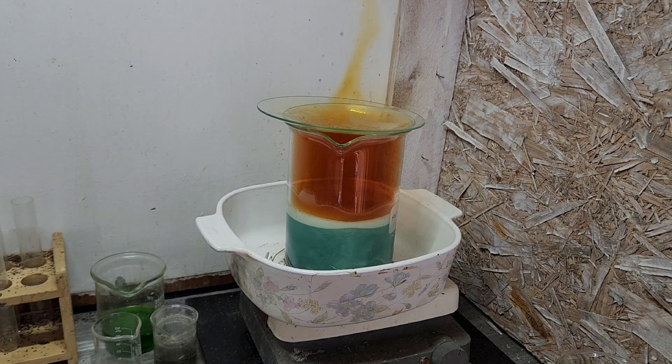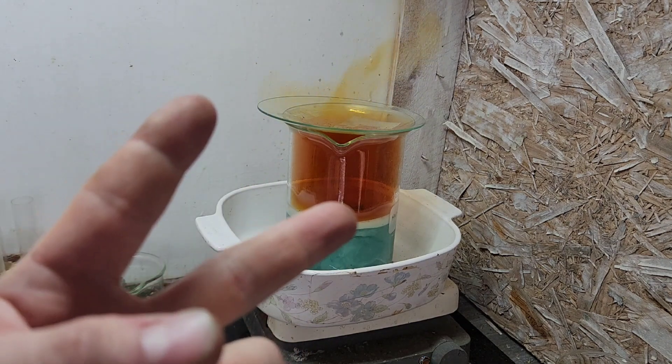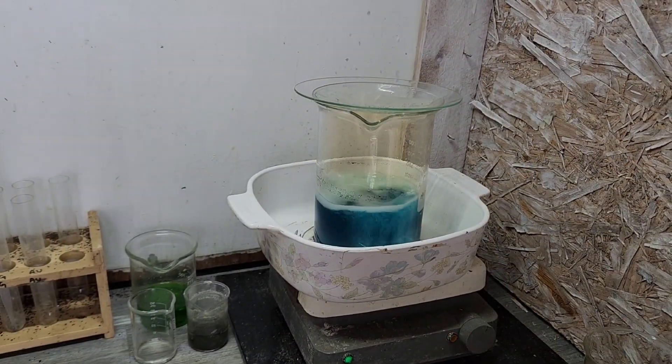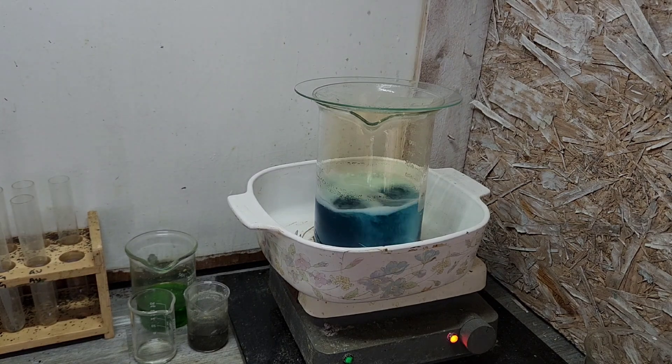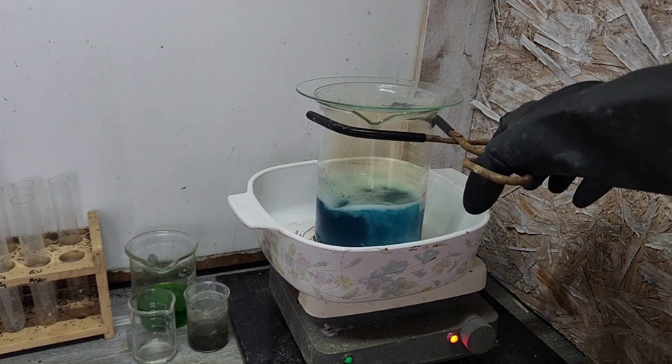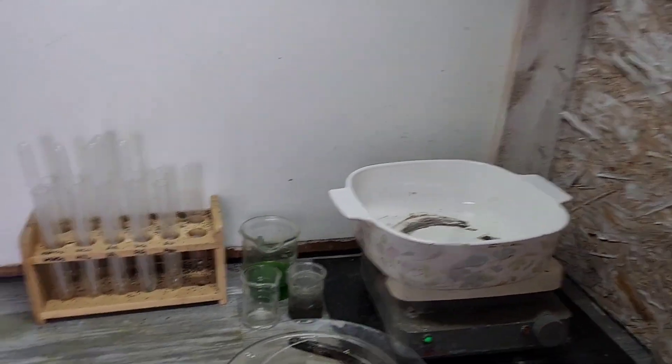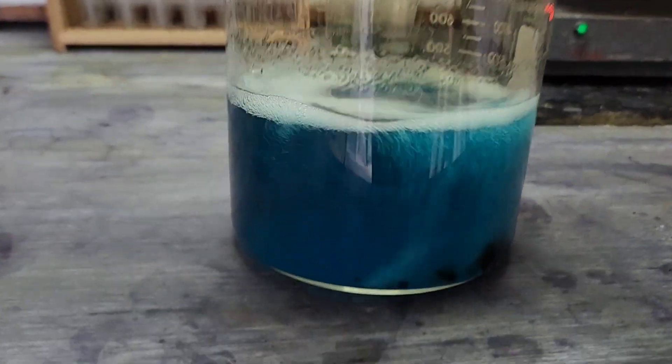Yeah, I think we're good. All righty, well let's see what that does. Round two. All right, looks like round two is just about done, probably close enough to add a little top up in there. Let's see where we're at. Man, do I miss these days.